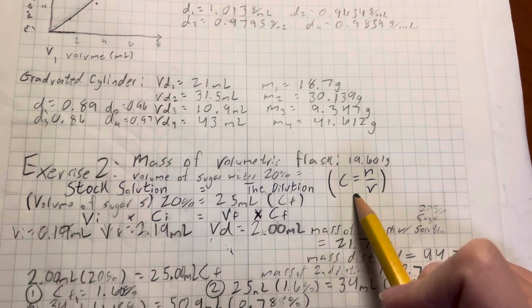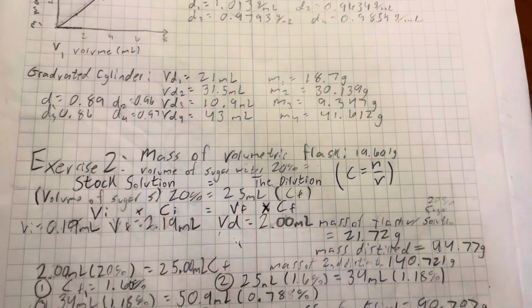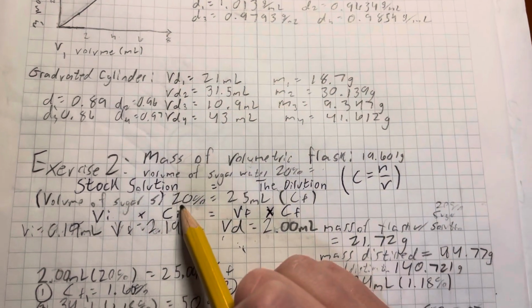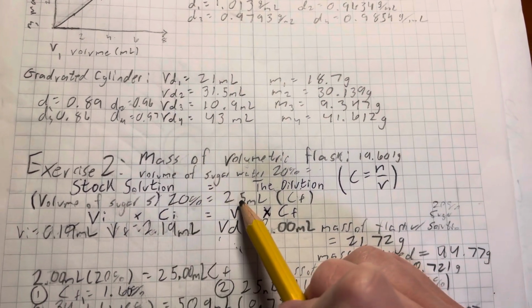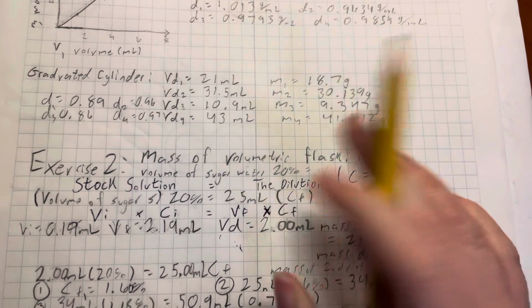We can use this relationship to our own benefit, because if we are given a known initial volume and a known initial concentration, we are able to change the final volume to whatever we want to find an unknown concentration. That would be a bit harder to calculate.